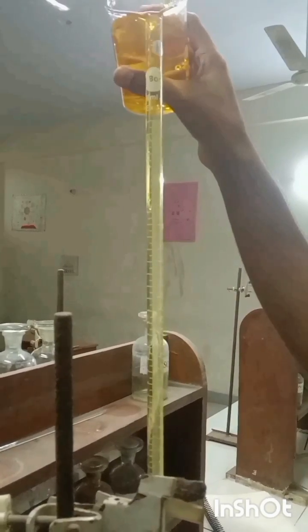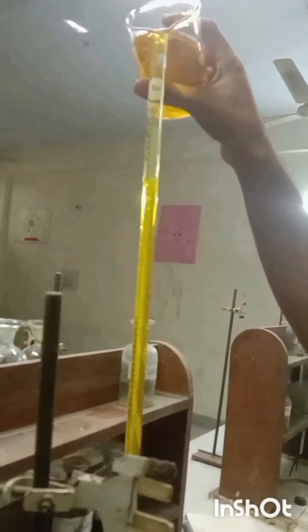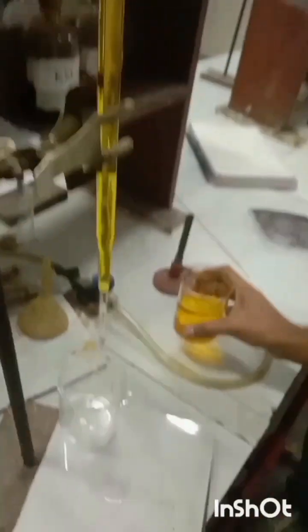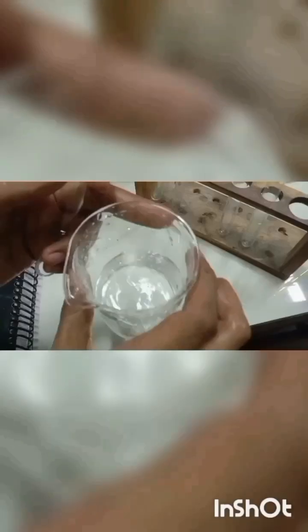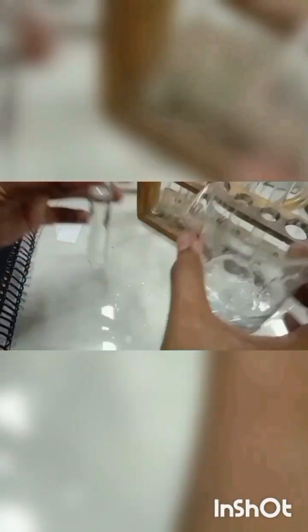Now fill this solution into the burette up to the 0 mark completely. Then take a beaker containing only distilled water, transfer this water into a test tube and then into a cuvette. This will be our blank solution.